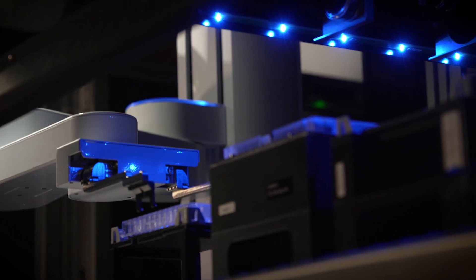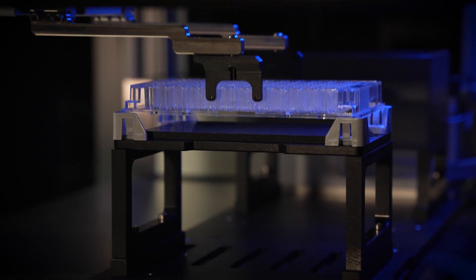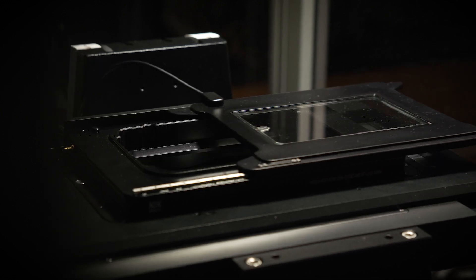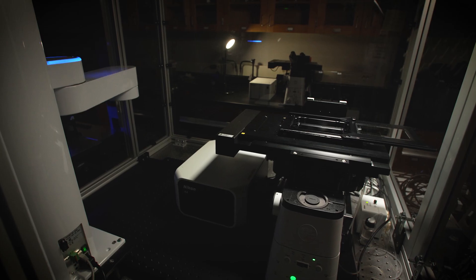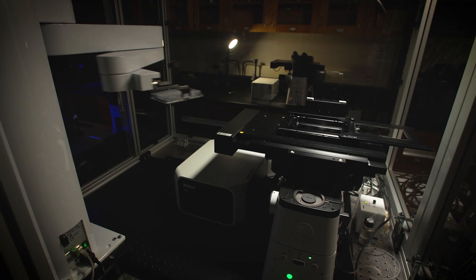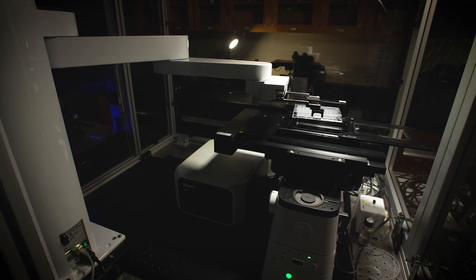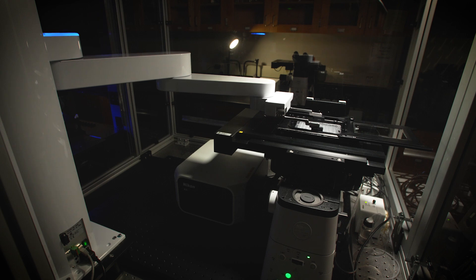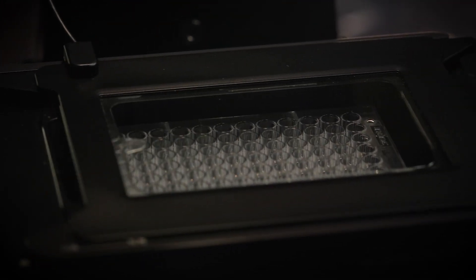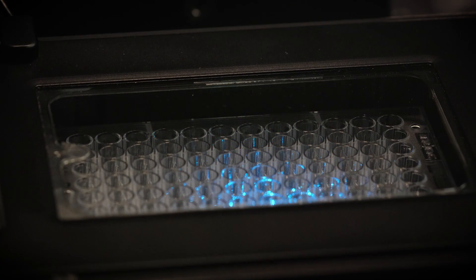The growing trend in the biotech space and drug discovery is to not just look at one single molecule or one single compound but to really scale up. Recently, Nikon has collaborated with us to install a robotic arm, which will dramatically increase our throughput and be compatible with industry needs down the line.